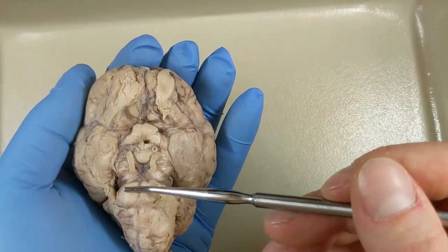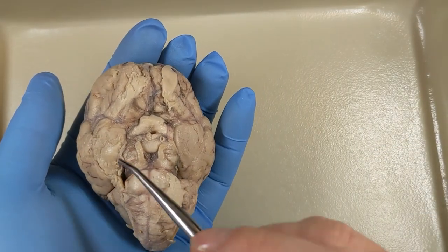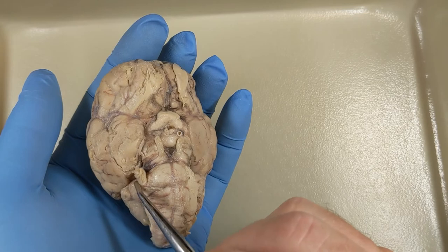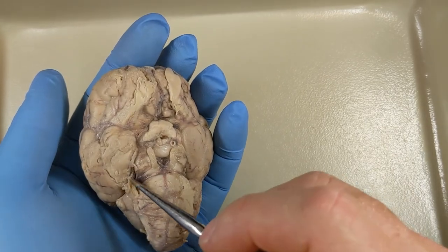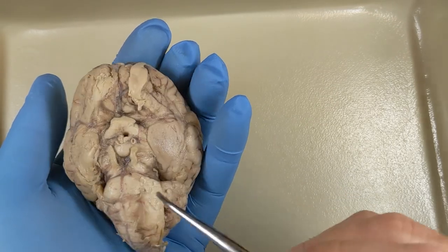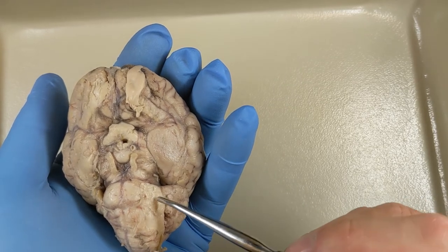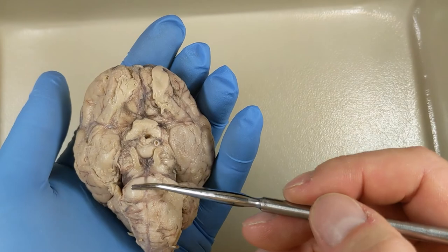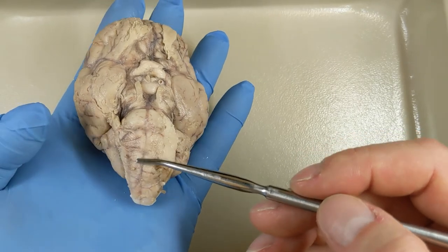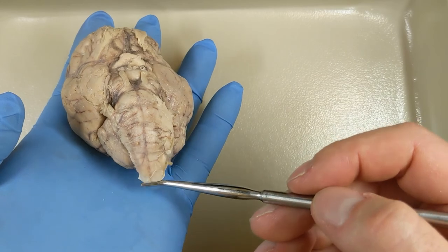Caudal to that, you'll find the pons right here, from about here over to there. Coming out of either side of the pons, before you get to the cerebellum, you'll find the trigeminal nerve right there. Sometimes you'll have a nice big stump, sometimes a small stump, and sometimes, like on this specimen, you won't have any stump at all — but this is where it would have been attached. Just caudal to the pons is the medulla, which goes from here to about here, and then the spinal cord from there back.